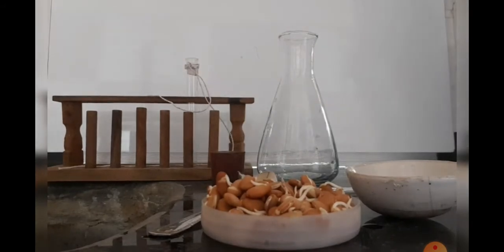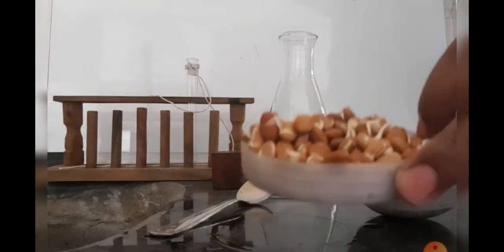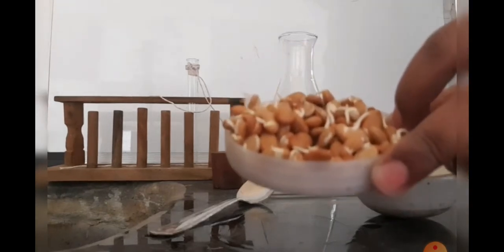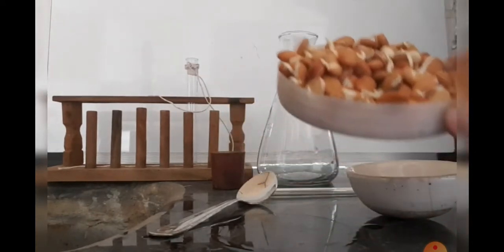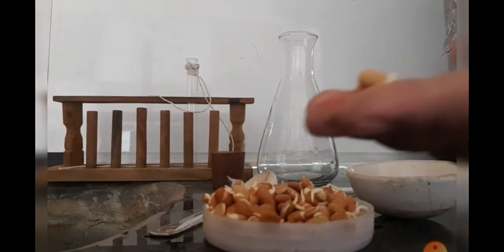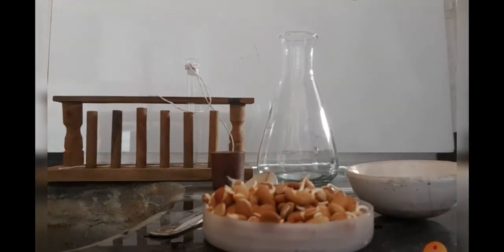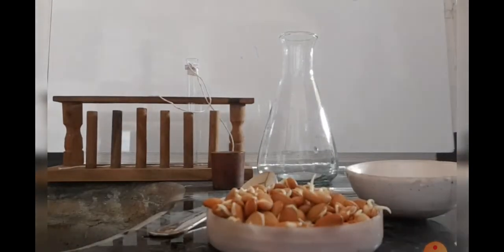First, what we need to do is soak beans — we can take moong ki beans — we have to soak them in water overnight and then keep them on a wet cotton cloth. If we keep them on a wet cotton cloth, they will get sprouted. Here you can see these sprouted beans are already ready.